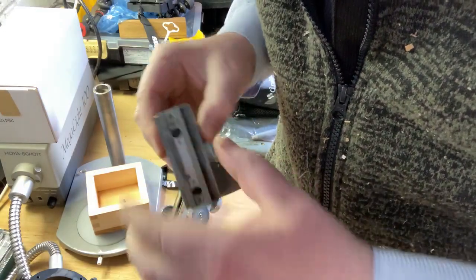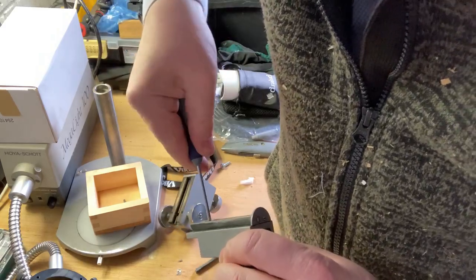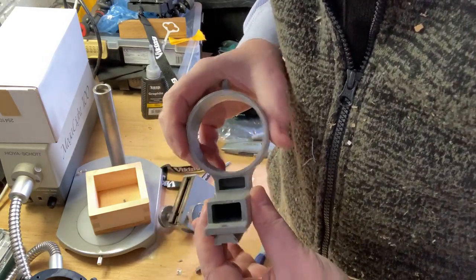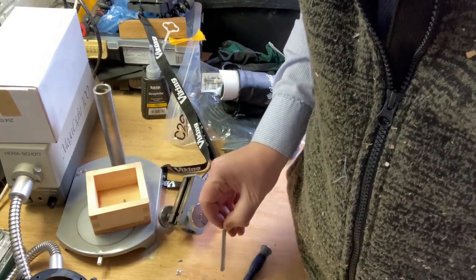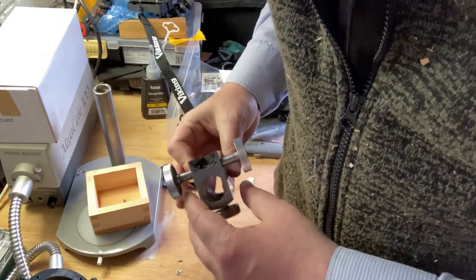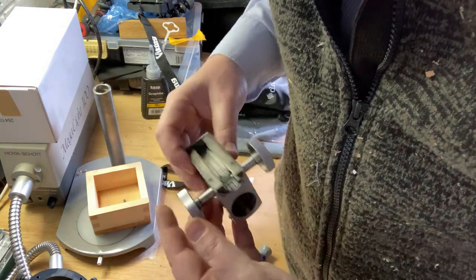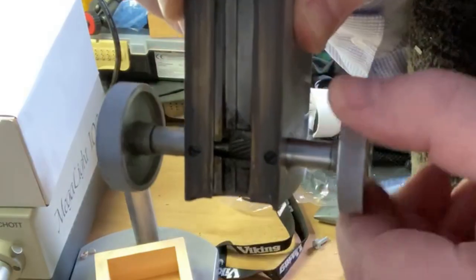So this is the mechanism. If I was to take this out as well, I think I need a bigger screwdriver, which I'll need to get in a minute. But basically I could probably replace this part here or this part to then have this section here, but it's curved.